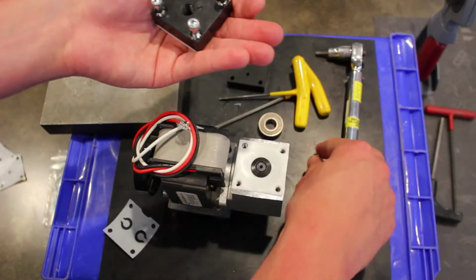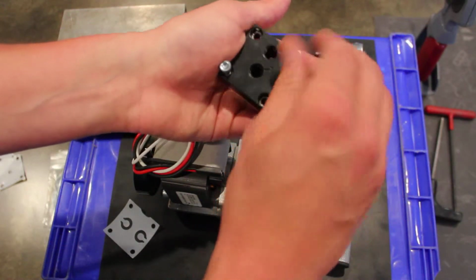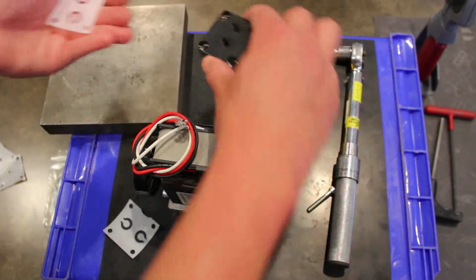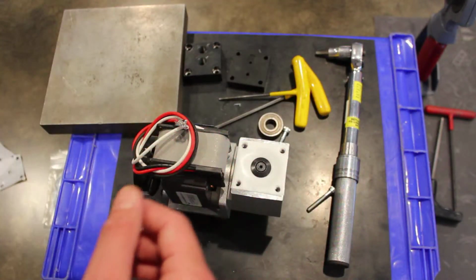screws. I like to be careful with these screws and not pull out the lock washers because they're small and can get lost easily. So if we just pull those bolts out without losing the lock washers, we can take that head and just set it down right here. This is our old gasket. We'll go ahead and discard that.